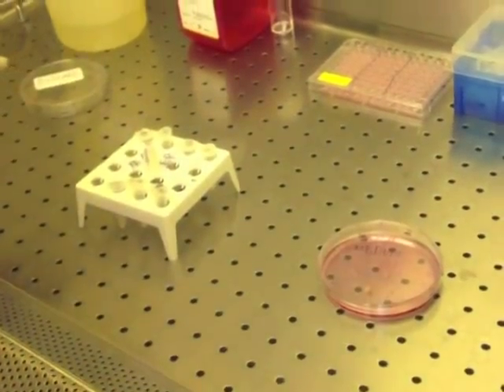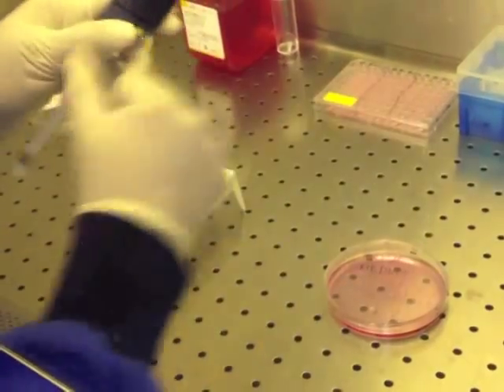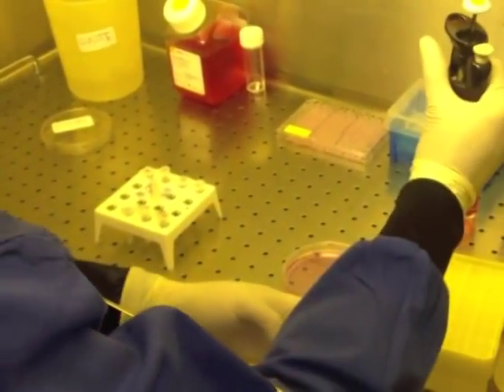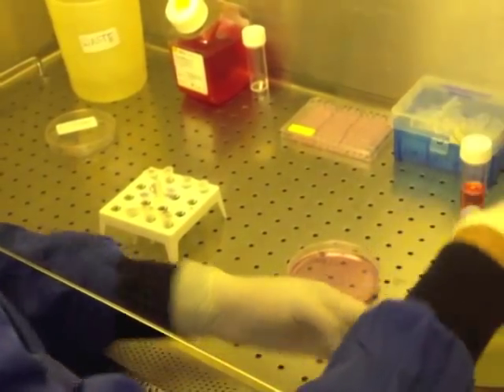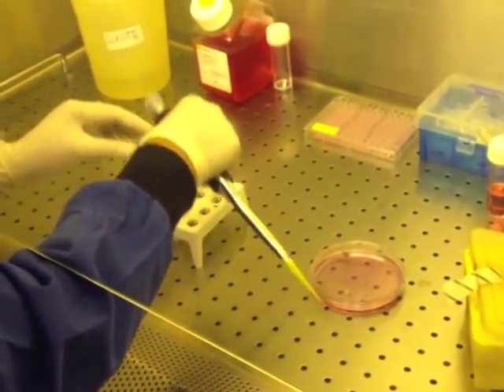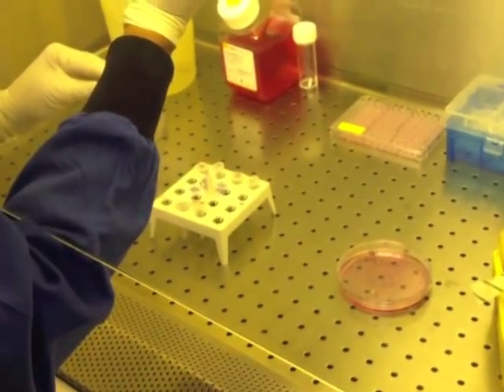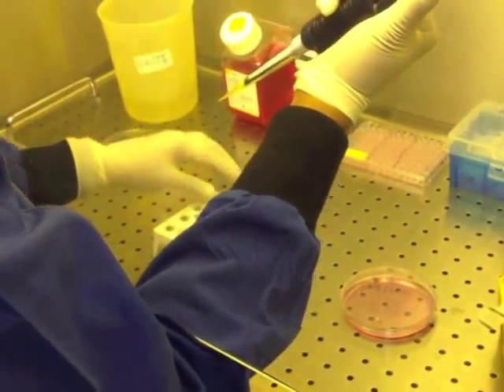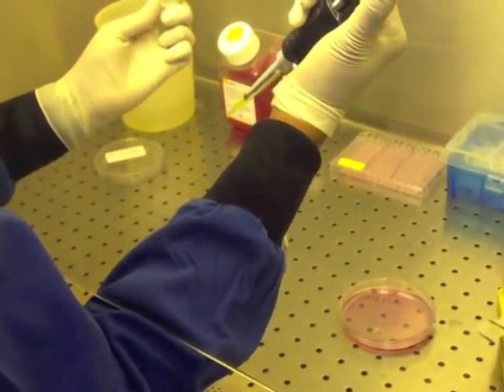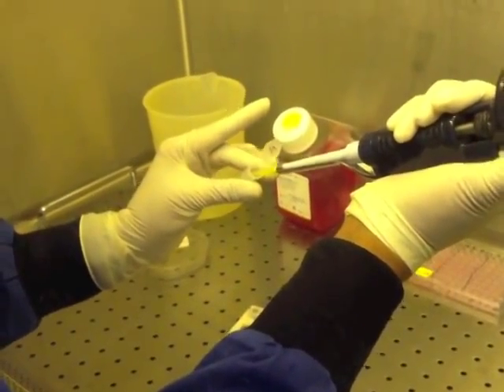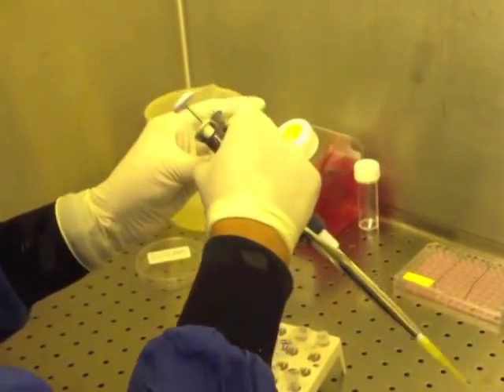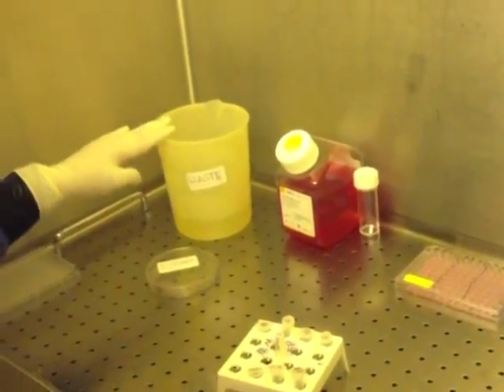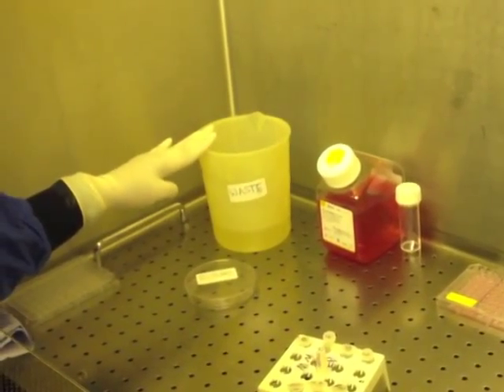So I'll take 100 microliters of the drug stock solution, add it to your final solution A, and discard the tip in the beaker labeled waste.